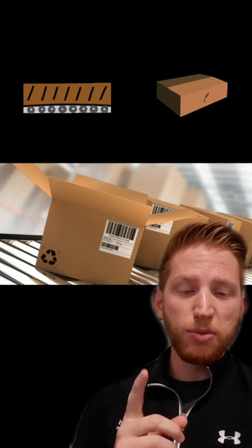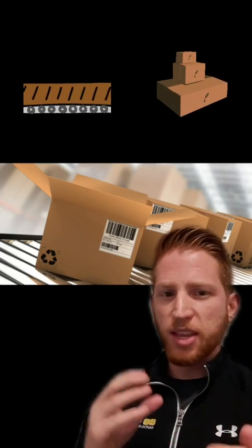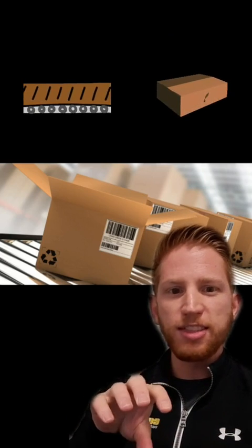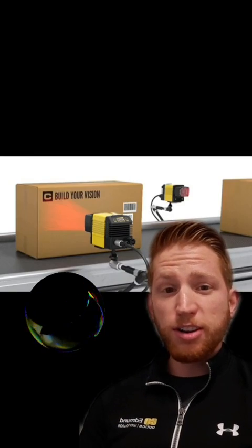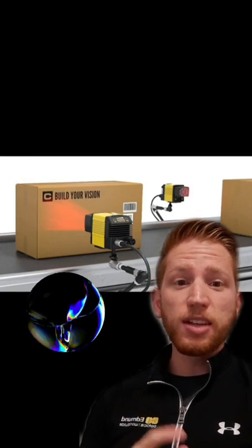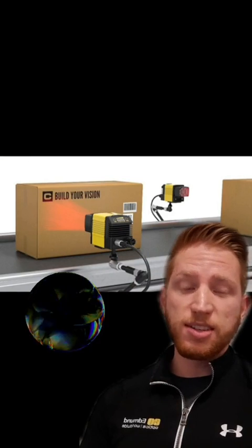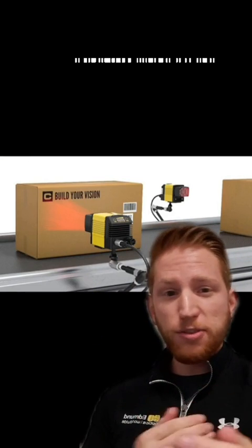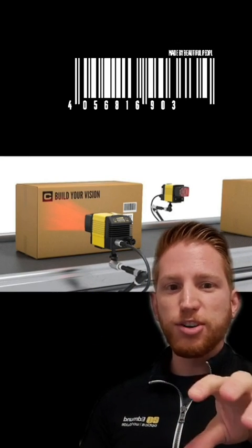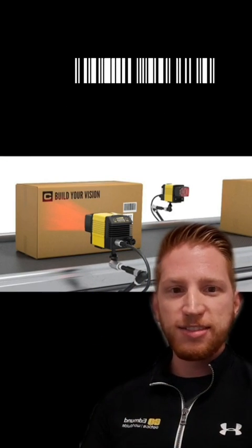Now imagine a conveyor belt with boxes on it at different distances from the camera trying to look at them. Some of the barcodes may be out of focus. But if liquid lenses are integrated into an imaging system, it can electronically shift that focus position to make sure you're seeing the barcodes in focus no matter where they are.